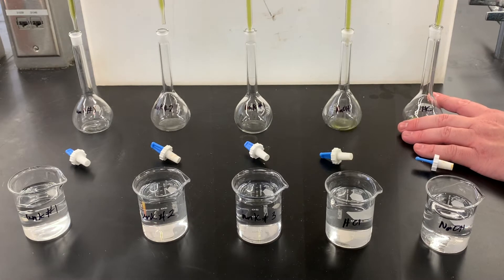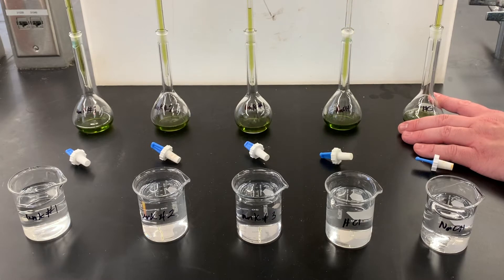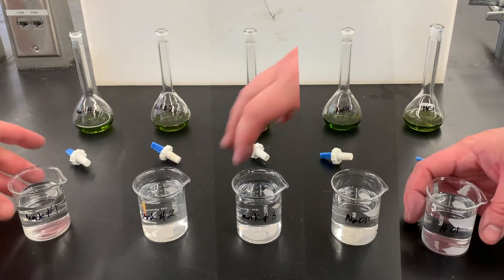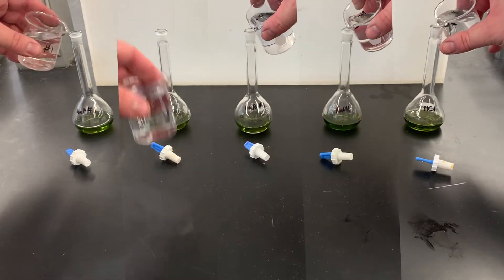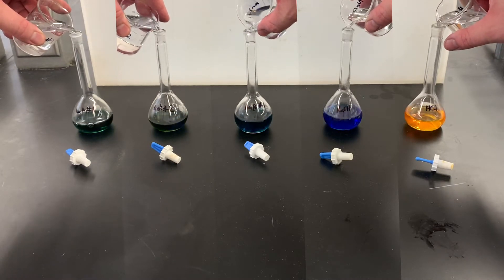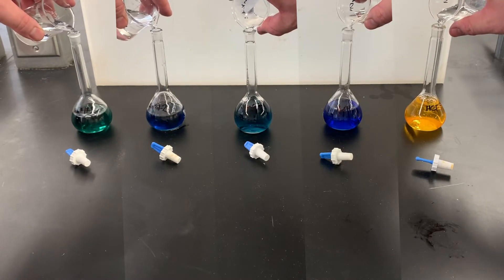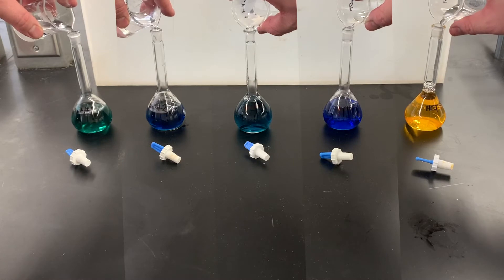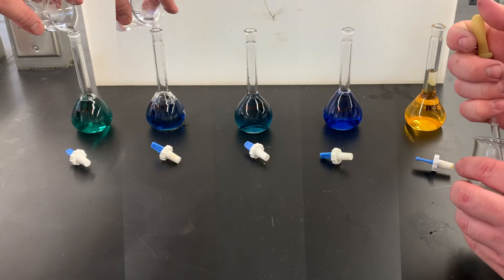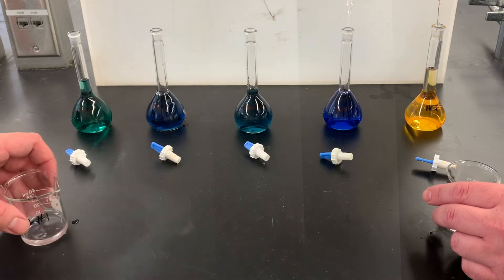I have here volumetric flasks for each one. In your case, you're going to only have one — this is mainly just a split screen so you can see, and I don't waste your time doing this five times. Once you have all the indicator in there, we're going to add in the hydrochloric acid, the sodium hydroxide, and each one of the weak acids. In reality, you do this one at a time. You're going to bring that down to the mark, and then the last little bit, you just pipette it, just to make sure that you get to the exact correct amount.